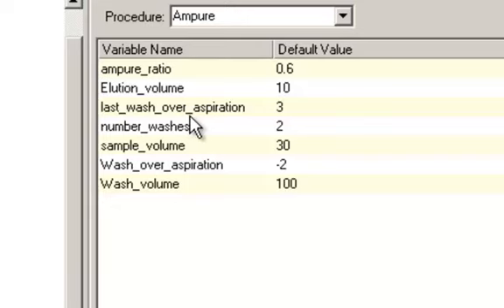Last wash over aspiration, and that basically, when we wash the beads, we have it set up so we can leave a little volume behind. So if we're doing 3 washes, we may leave 3 microliters behind for each wash except the last wash, and that's what these variables are used for. We have the number of washes. By default it's set to 2. We have the wash volume and the sample volume.